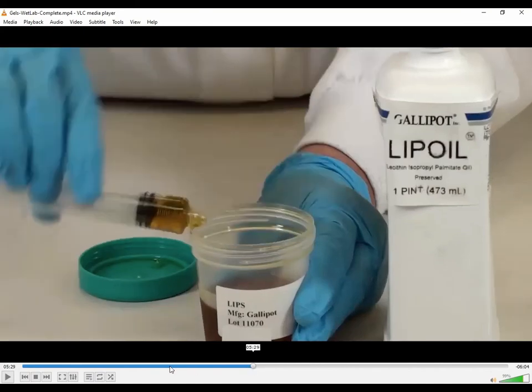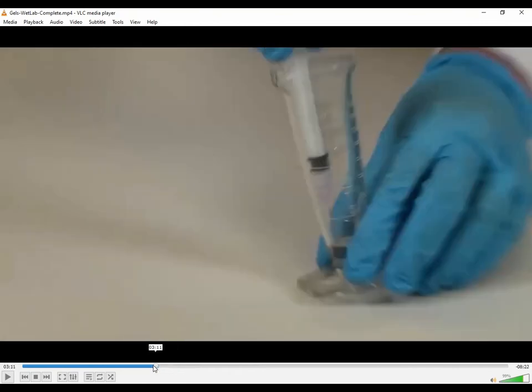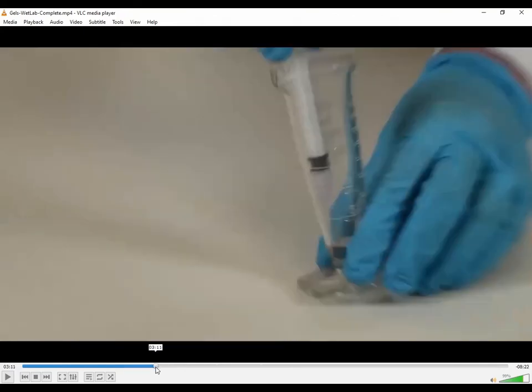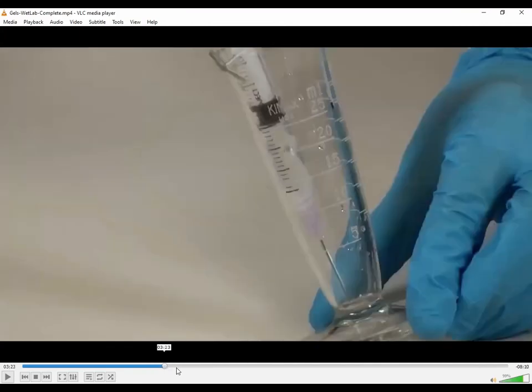What now? By then, you will have dissolved your solution. So again, your lidocaine acyclovir will be dissolved. Take your 3 mil syringe with that needle that you didn't throw away, set it aside. You need that long needle on there so you can put it back into the conical and suck it all out. So you're going to suck out that 1 milliliter of lidocaine acyclovir solution back into that 3 milliliter syringe. Okay, so that's what she's doing now.